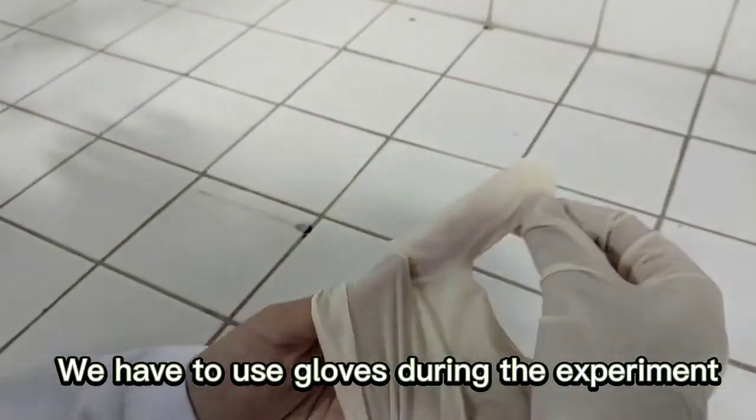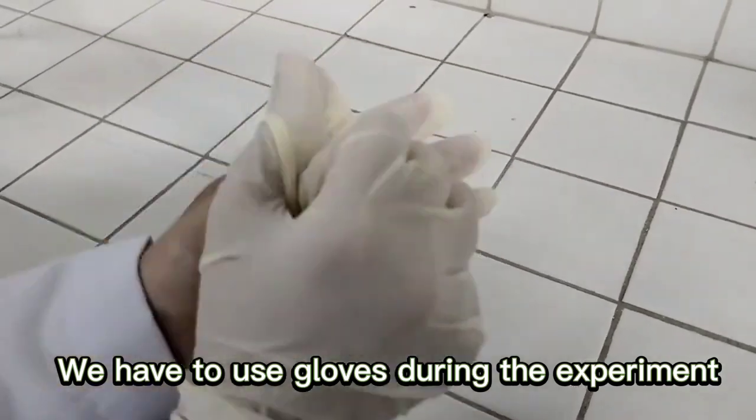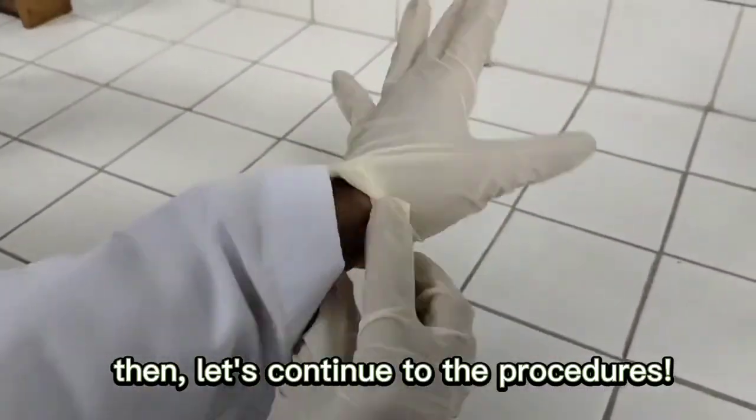We have to use gloves during the experiment, then let's continue to the procedures.